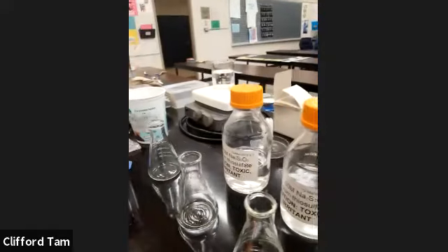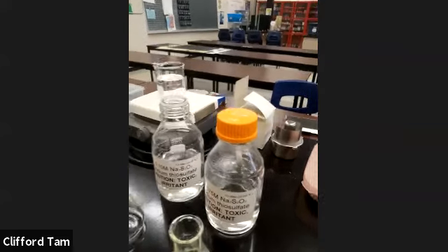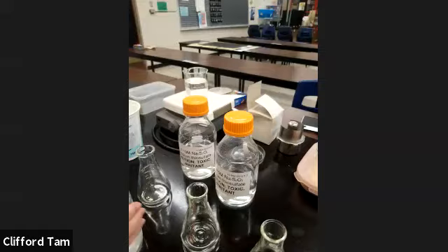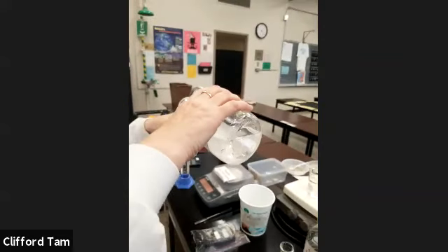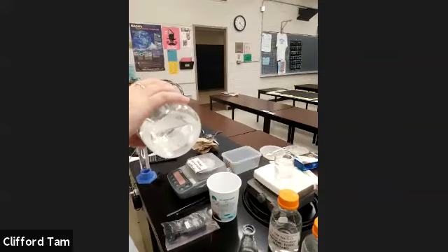And what Xantha is doing is essentially changing up the concentration of the sodium thiosulfate. As you guys can see, there are 3 containers here, each with a different concentration. So she's now going to put 20 ml of that reactant into the HCl, and we're going to see what happens.